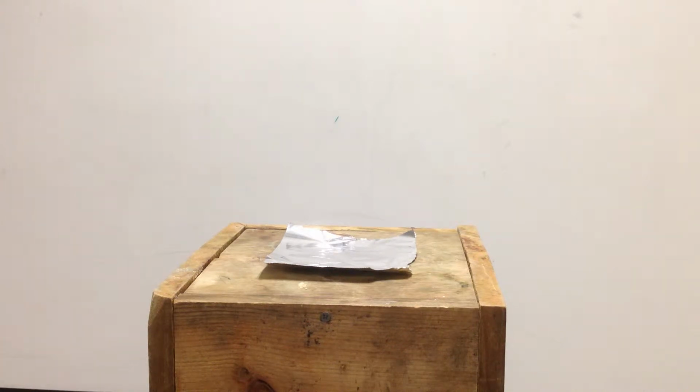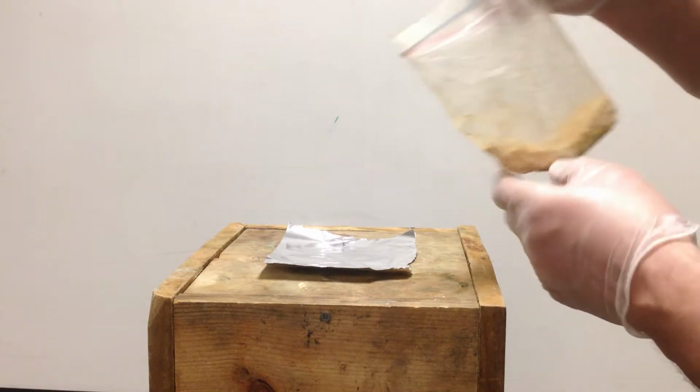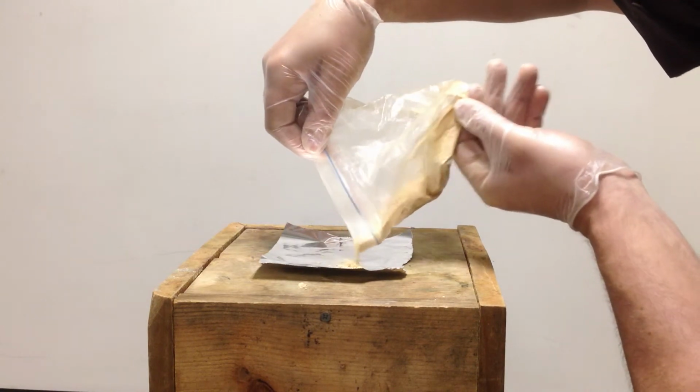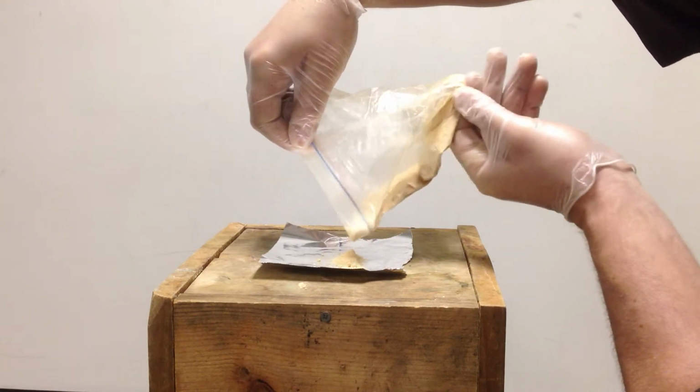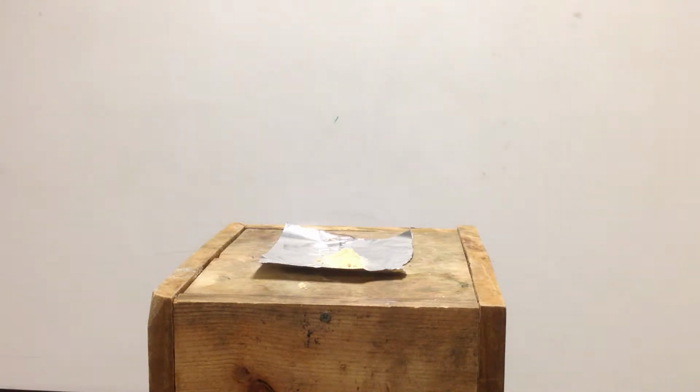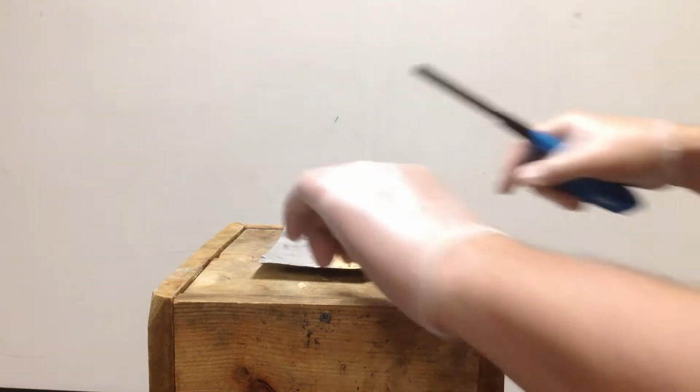In this demonstration, I am going to illustrate the effects of surface area. So I'm going to start with taking some sawdust that we got from our local wood shop here. And this sawdust is finely ground wood. And we know that wood reacts with the air and combusts. So I'm just going to make a little pile of sawdust. And it's going to react with the air and combust, like I said.